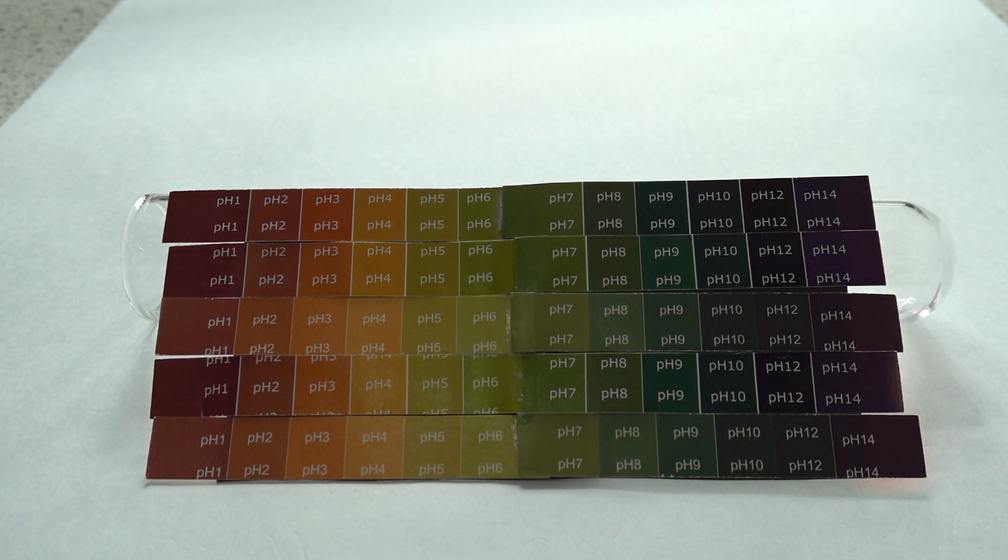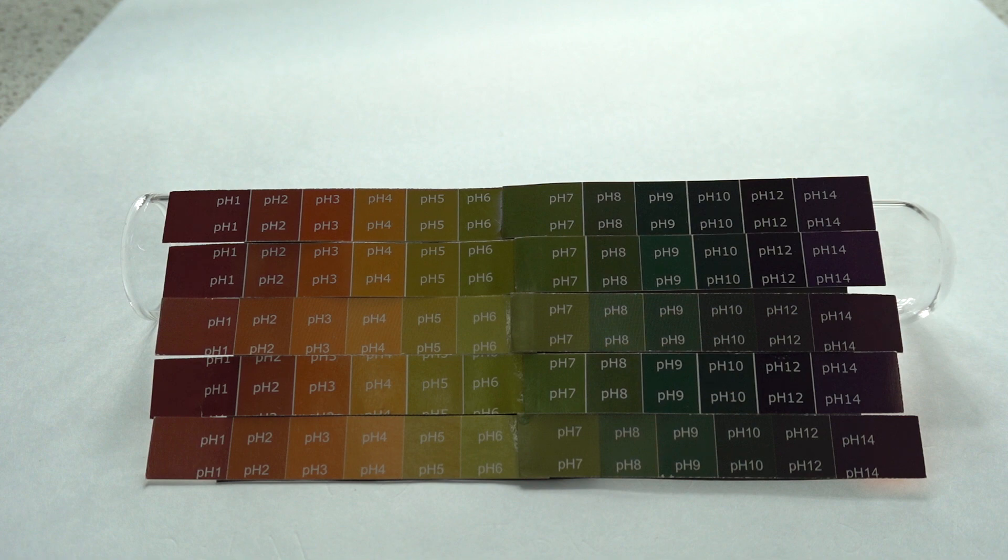Using universal indicator to record the pH of solutions in chemistry. We can't really demonstrate this on camera because the color rendition by the video camera is too unreliable, and we can see this by looking at a few examples.